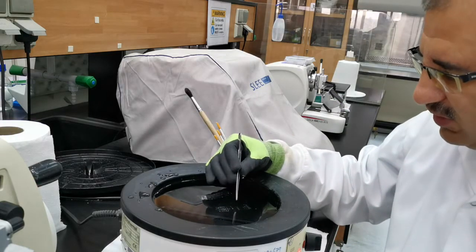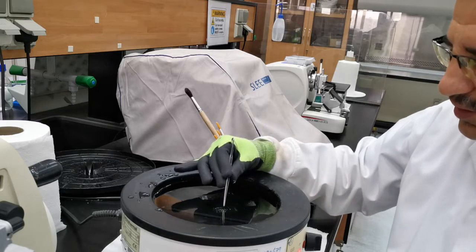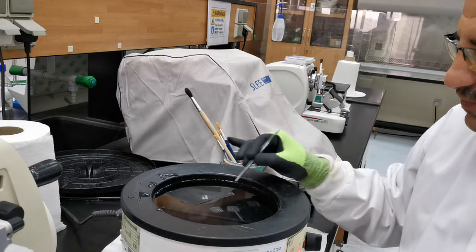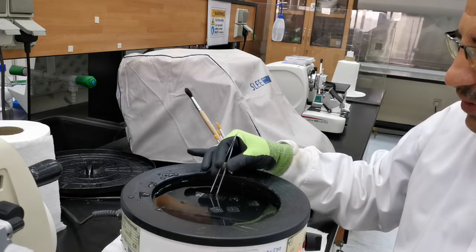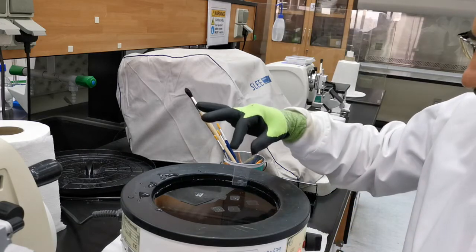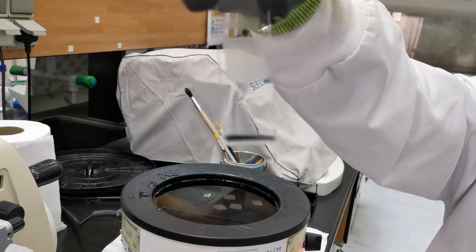At the line between two sections, I do a separation with the tweezer like this. Now I separate one section alone. The trick is having clean edges on the tweezer. So here we go — now there are single sections. I can do this one and this one as well. Now I need to load those sections onto a slide. With the slide, I go next to the section, down to the edge of the section, and here we go — the section is loaded onto the slide.